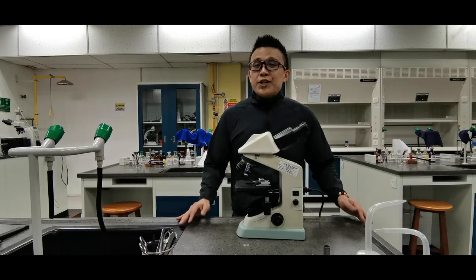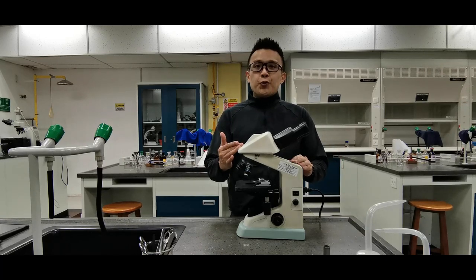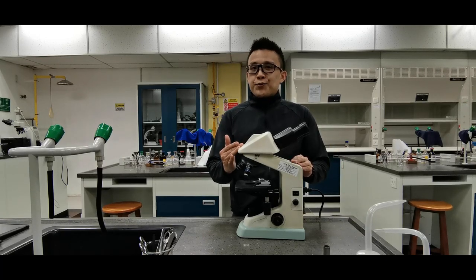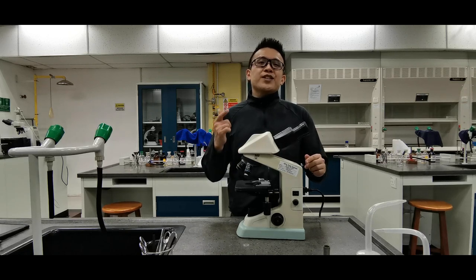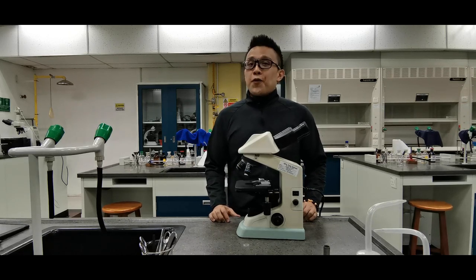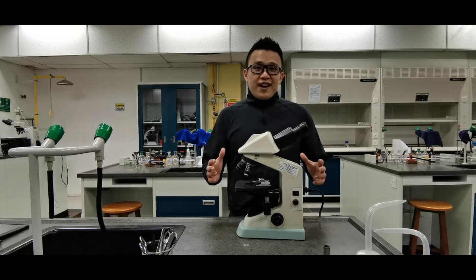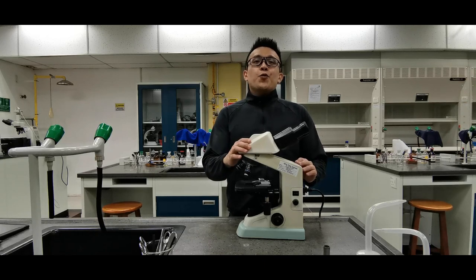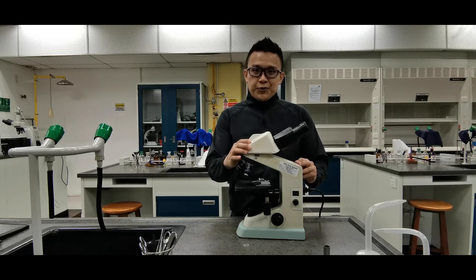Hi everyone. In today's video I'm going to show you the parts of a microscope and how to use a microscope effectively for your exams. To start, let us go with the basic setup of your microscope.